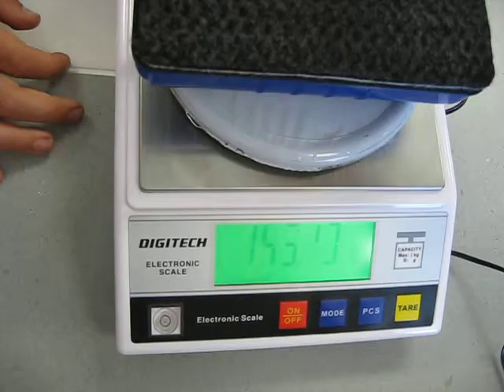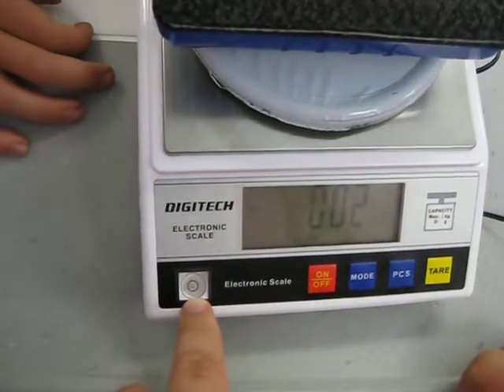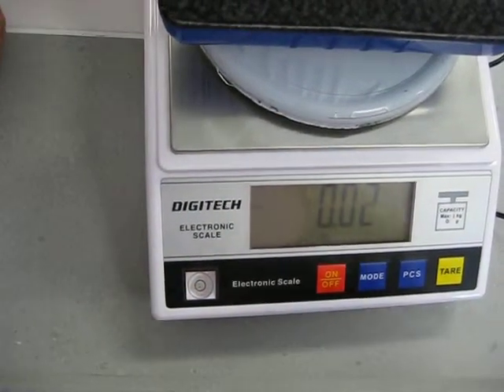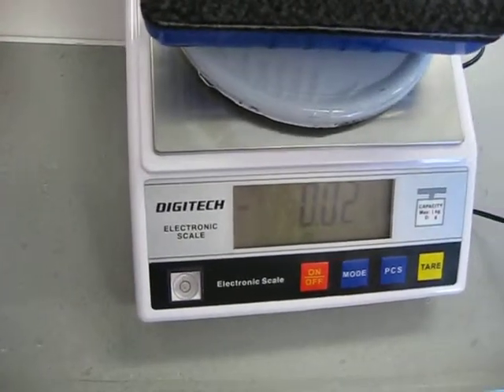And that's how you use a balance. Also, one other thing — there's a little circle here. Make sure the bubble is within the circle. If the bubble's within the circle, you're golden. It means it's flat.